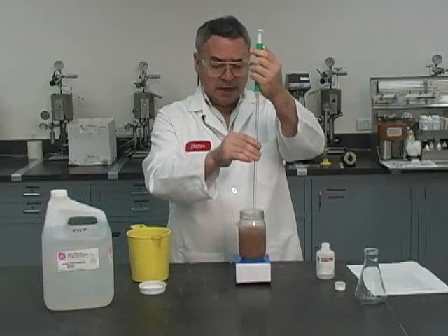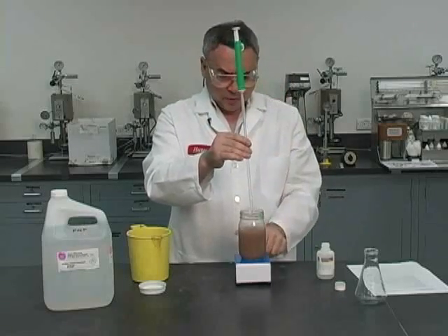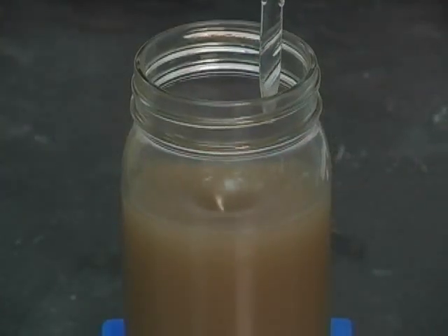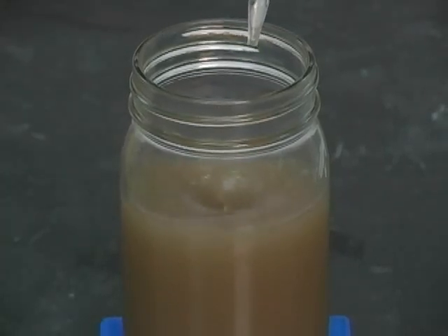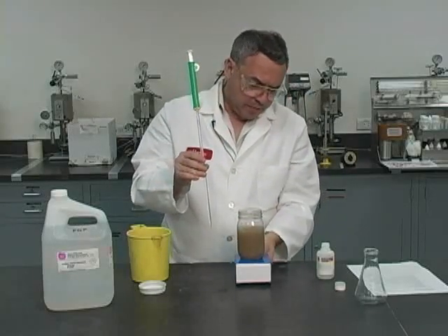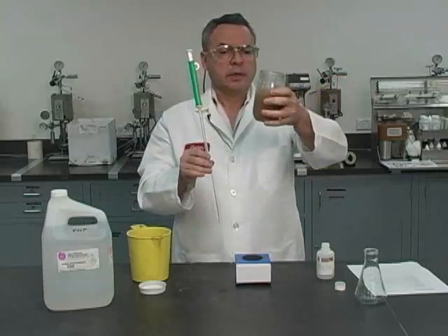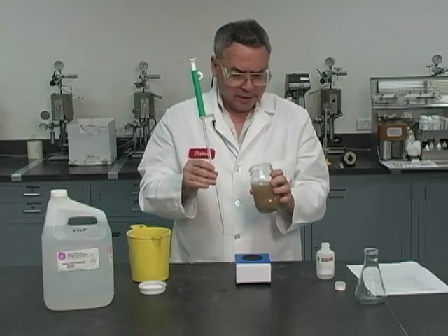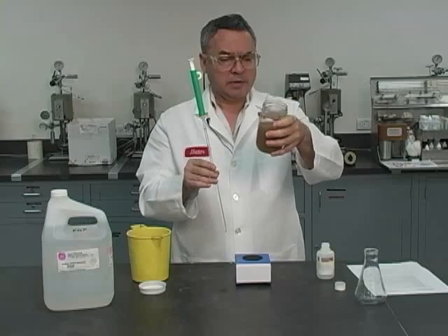So once I reach the final point, I'm going to make sure that the pink color stays away. Sometimes, in order for me to verify that, I might have to stop the rotation, the stirring here. Now we got a pure brown. I'm going to make sure that it stays this way. That means we have neutralized this emulsion. Looks to me like this is pretty much pure brown with no trace of pink. I'm going to have to wait approximately a minute and see if I see any tones of the pink color coming back as a consequence of the protons being absorbed by some alkaline elements that are still in solution.